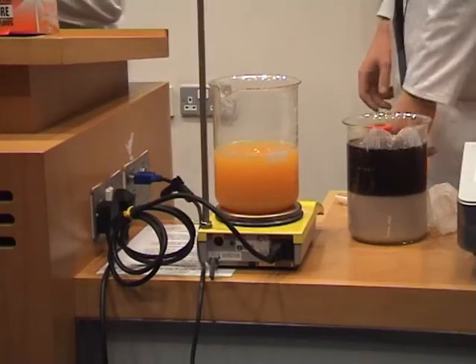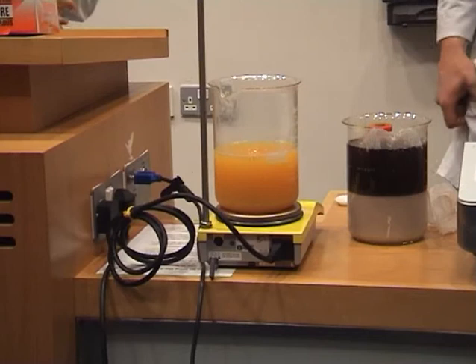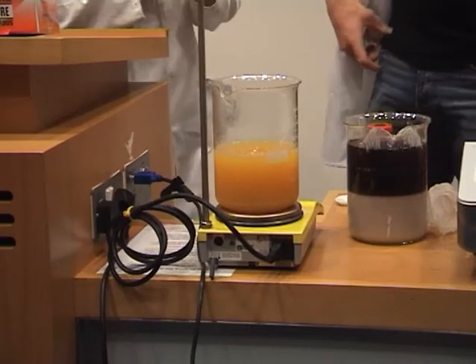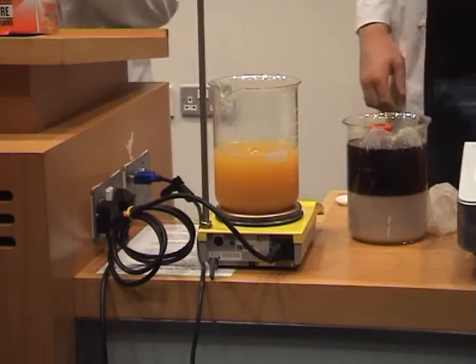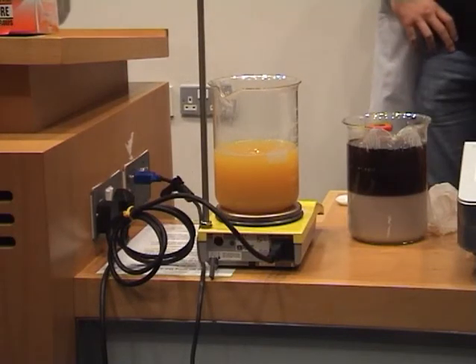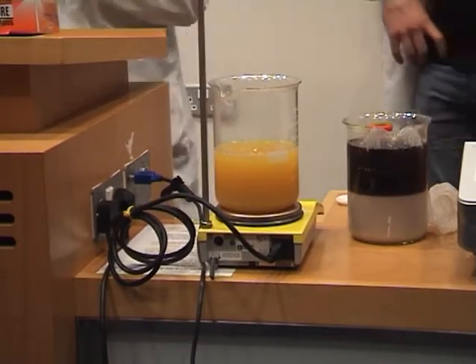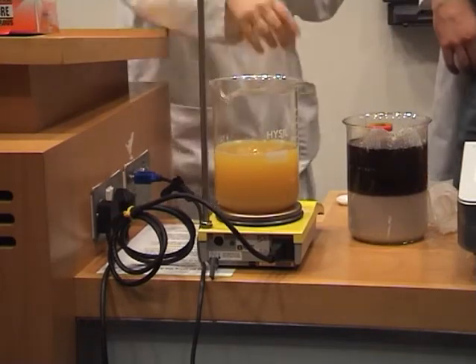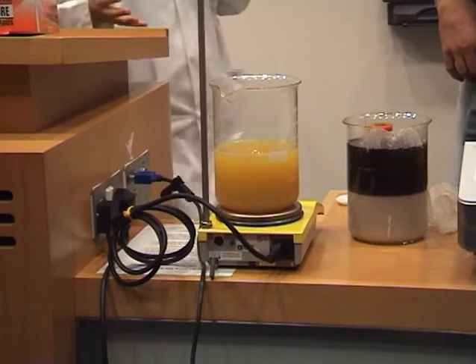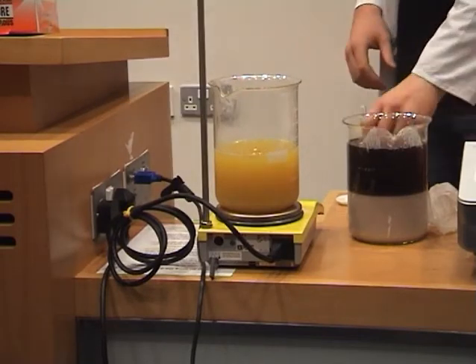Okay, I reckon there's something astray here. How much magnesium hydroxide did you put in? Plenty. Did it all dissolve? The magnesium hydroxide is acting as a base. And when Daniel made it, being eager, he put in lots. And this is all cloudy here, all dissolved. And as it's dissolving, it's using up our acid. So I tell you what we do, get some out of there quickly while it's still red, and get it in here. We'll see if we can do that with the eye dropper.